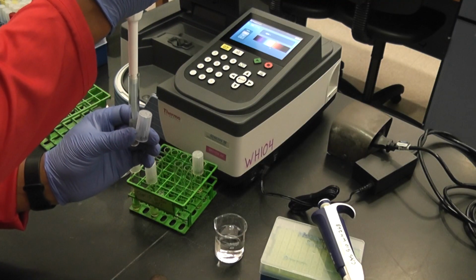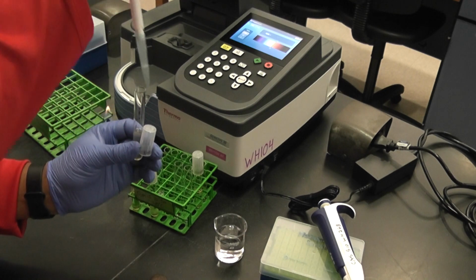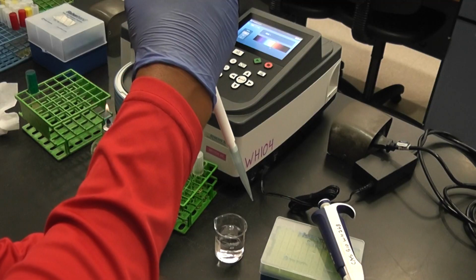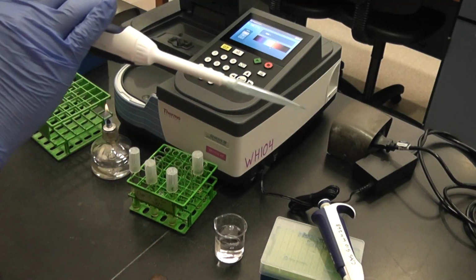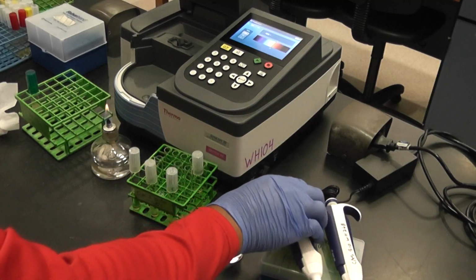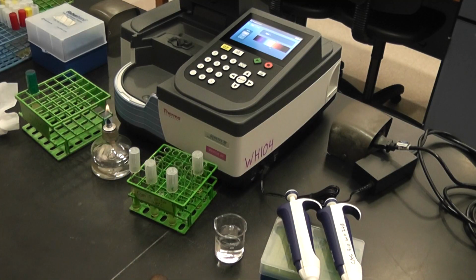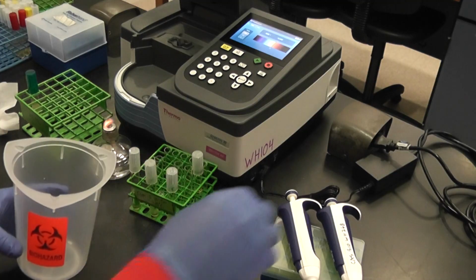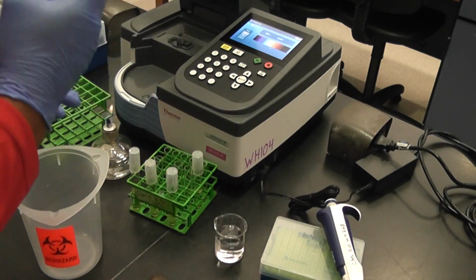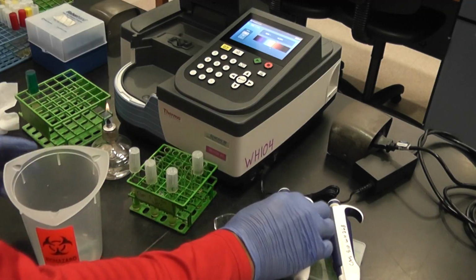Suck this up and down. So as you can see, the concentration of bacteria went up. So this needs to be discarded. This is a dirty tip, so I'm gonna put it into a waste bin. The waste bins should be at your table. This one broke. Some student might have messed that one up.